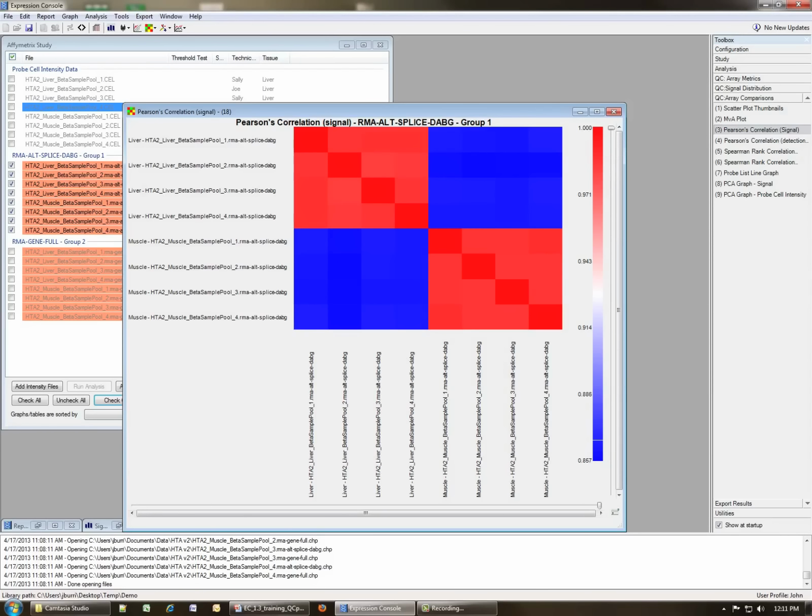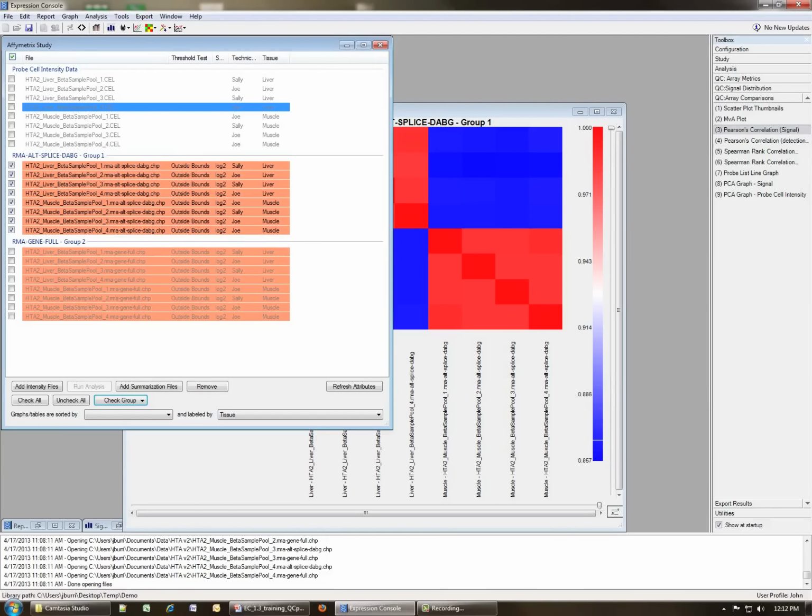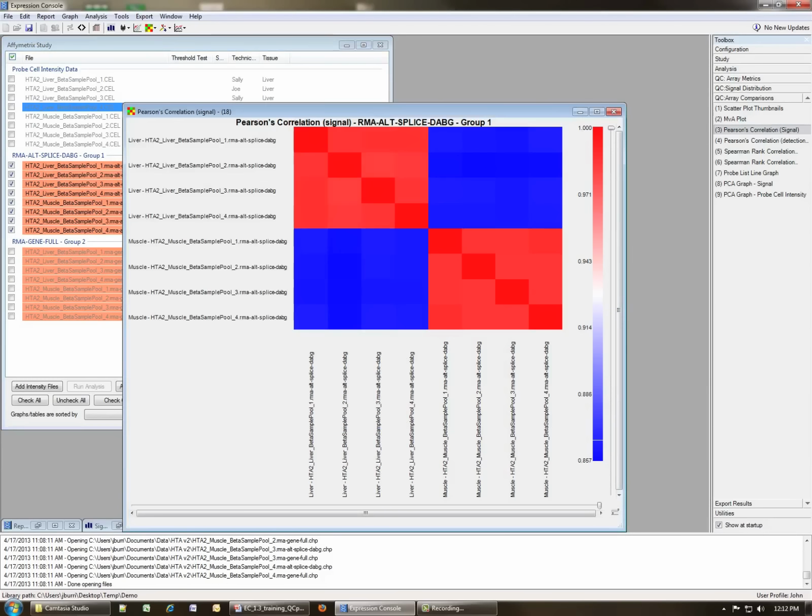One thing that I have always set up on my studies, which I forgot to show you guys how to do, is that you can see here we have muscle, which is one of the attributes for the files appended to the CEL file name. So if we go back to the Affymetrix study window, you can see that it's possible to have your graphs and tables sorted by a particular metric and also labeled. In this case I have the graphs and stuff not sorted at all, and then labeled by tissue, which is how we get the liver to show up at the beginning of each of the graphs.